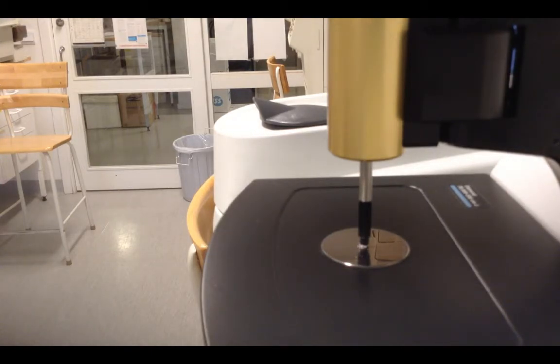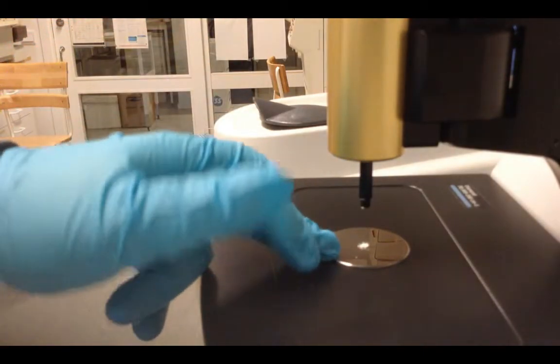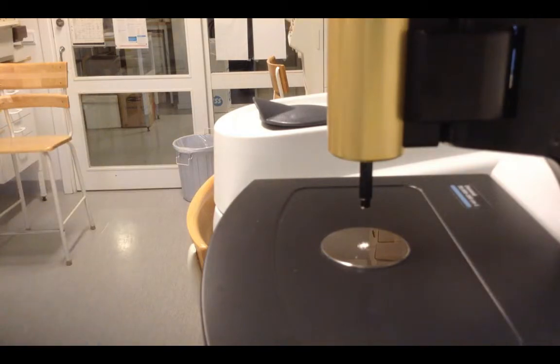After that, you withdraw the tip again and you need to clean the platform by using ethanol.